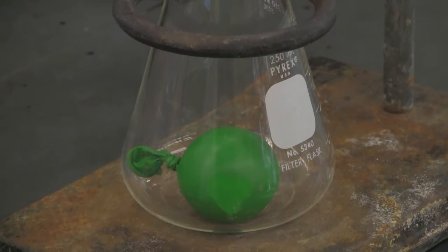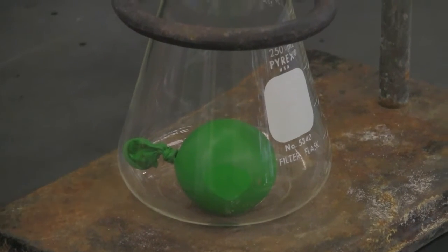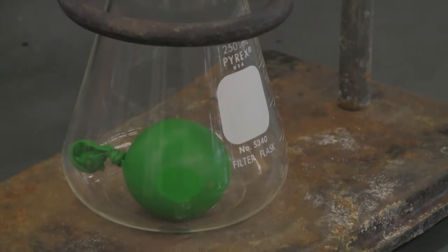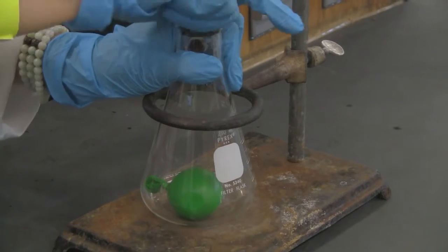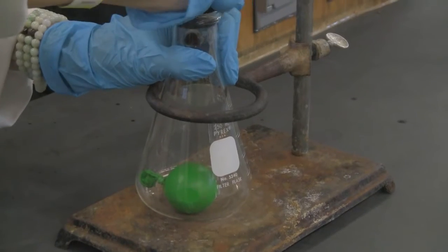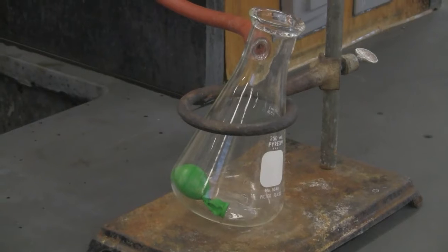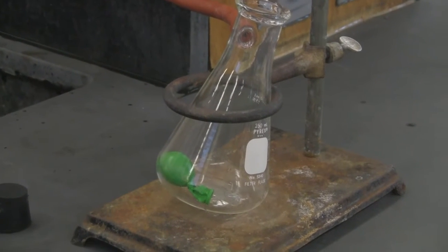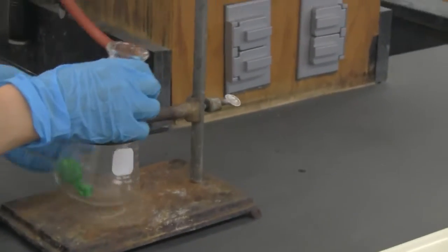Okay, pretty amazing, right? When I turn it off, just keep it that way. But now if I open this, you can see this is another change. Now I drew air out, less air, but now I will let the air into the flask. Closely watch the balloon. It suddenly shrinks. Okay, so this tests our Boyle's law. All right. So I'm going to still use this setup for our part C.